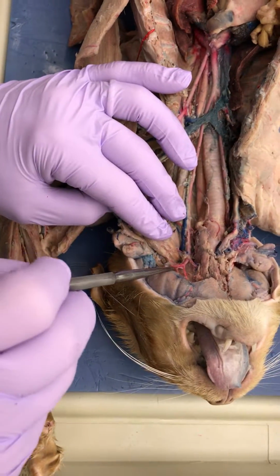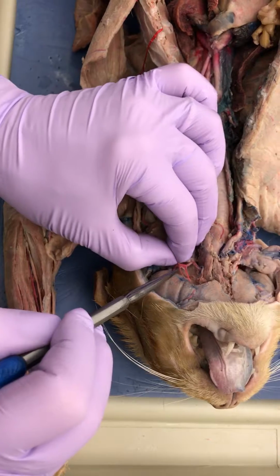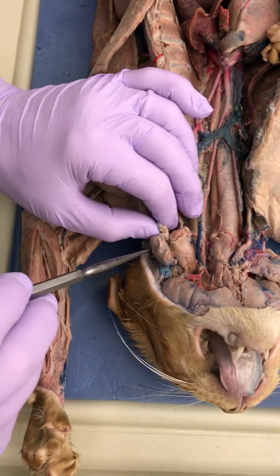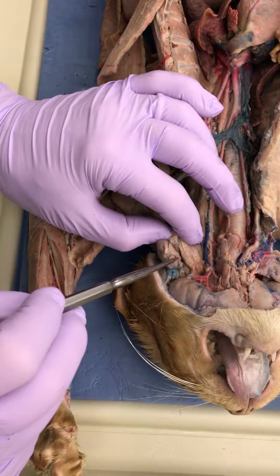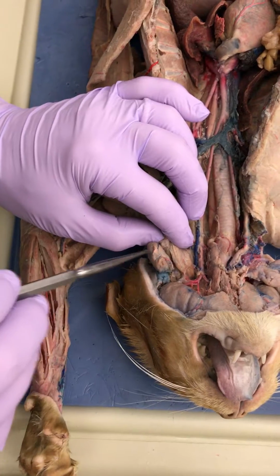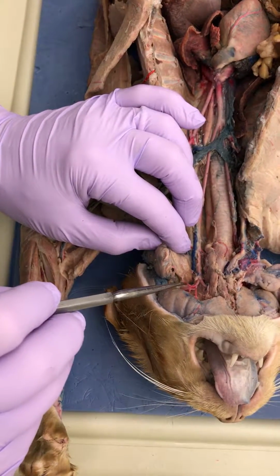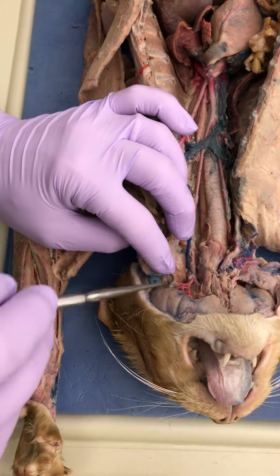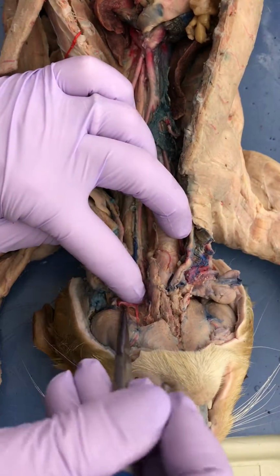Okay, so we did have a bust right there. I think it went over here. See where it broke? Oh, yeah. That was connected to that. So this is the parotid gland, so that little thing right there is the parotid artery, correct? Okay, then your whopper size one, look at the size of that thing.